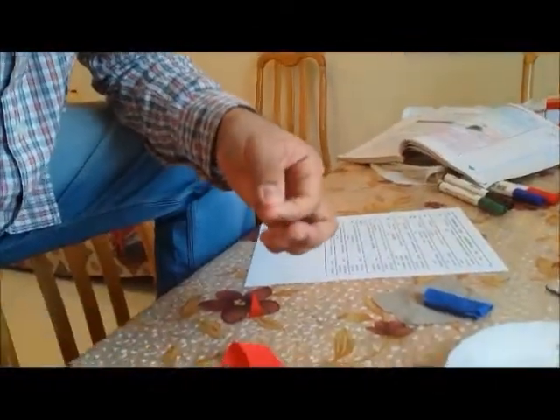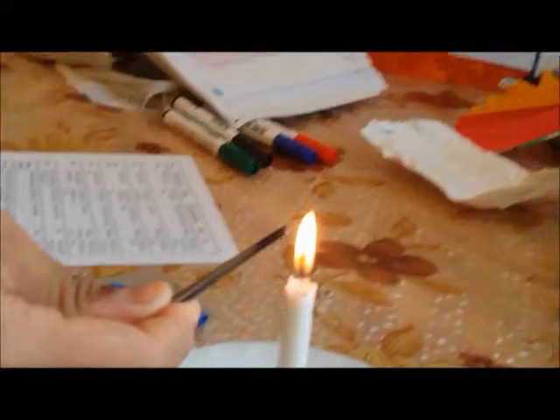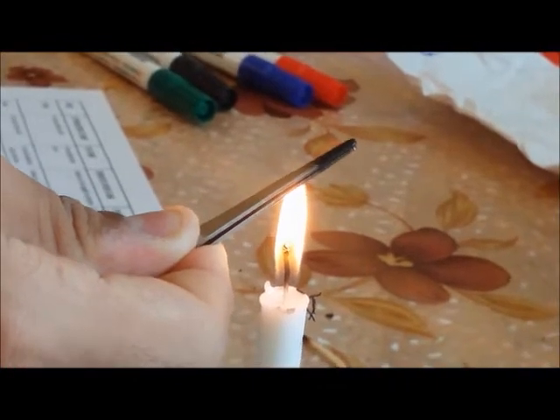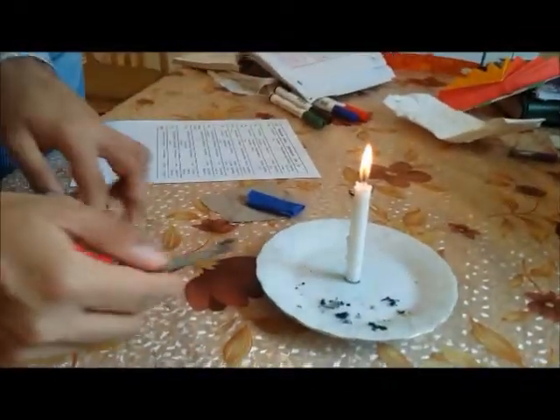I am using one yarn at the beginning. Don't forget to wipe your forceps off. Let's see what happens to it when brought further. As it approaches the flame it curls away and shrinks — shrinks from the flame, fuses and shrinks.